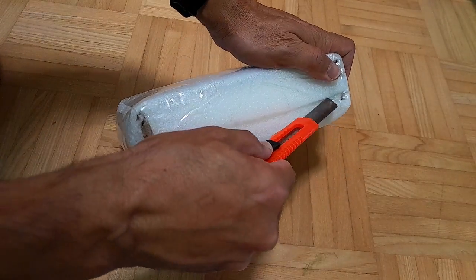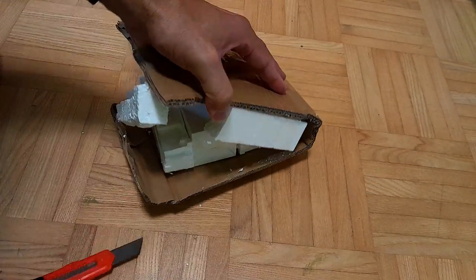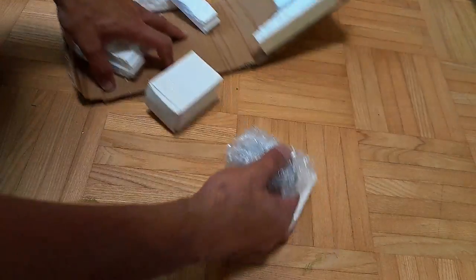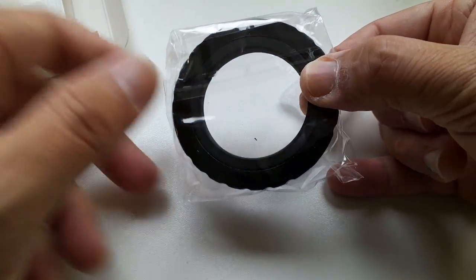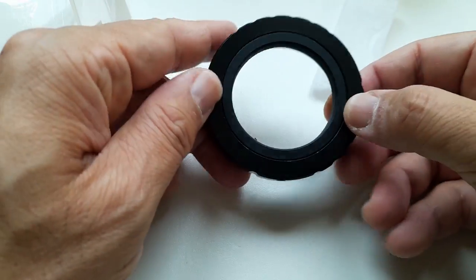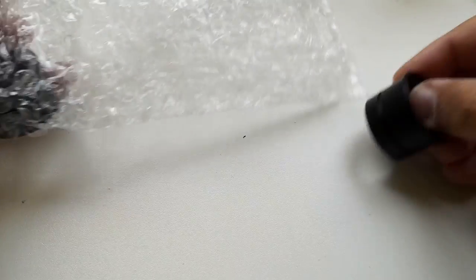It only took approximately 10 days to be mailed from China to Europe. And it's evident from the very beginning that it came directly out of the factory. There was a whole bunch of styrofoam cardboard. But generally, I would say that all of the different parts were packaged quite well. This is the T2 adapter ring. This is a camera-specific adapter. There are also adapter rings for mirrorless cameras and also for Nikon cameras, of course. I've got the Canon one.